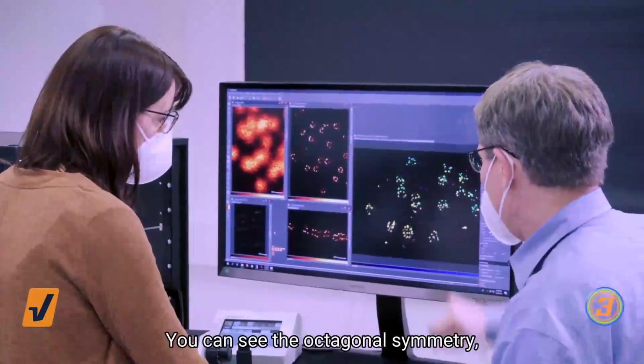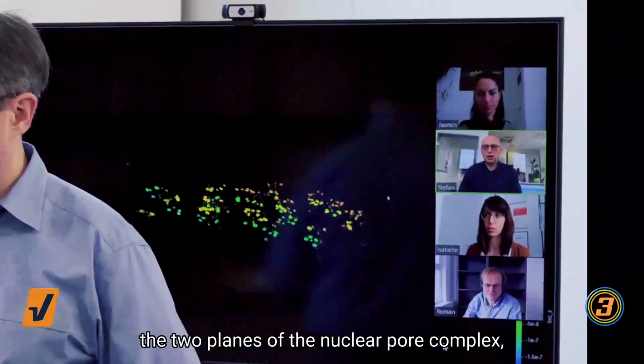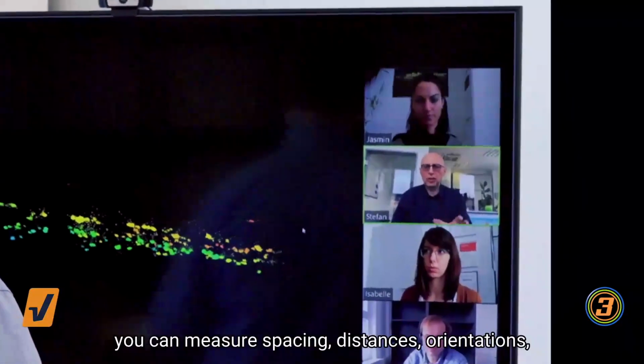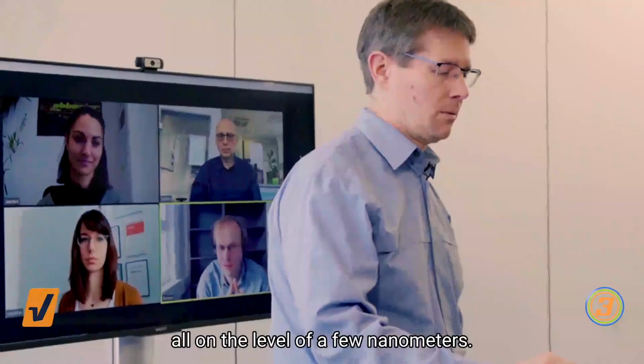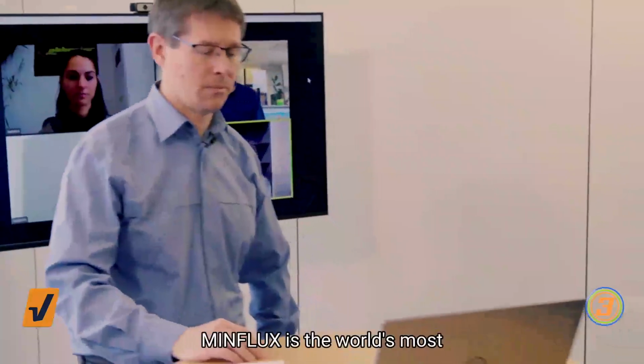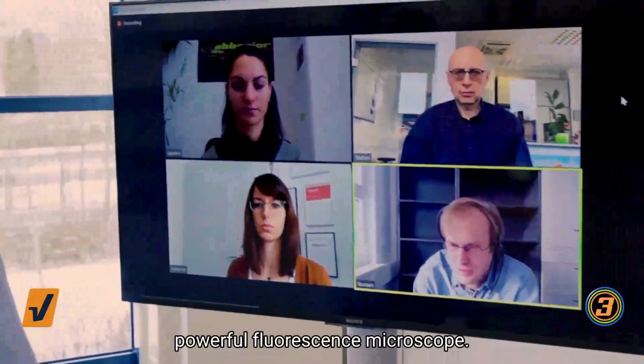You can see the octagonal symmetry, the 2 planes of the nuclear pore complex. You can measure spacing, distances, orientations, all on a level of a few nanometers. MINFLUX is the world's most powerful fluorescence microscope.